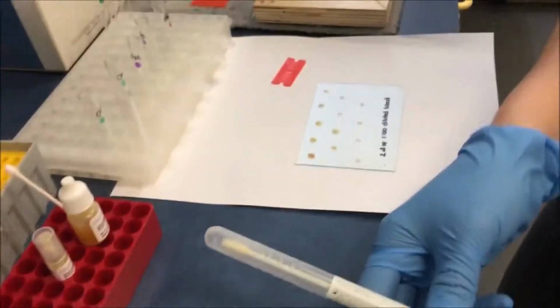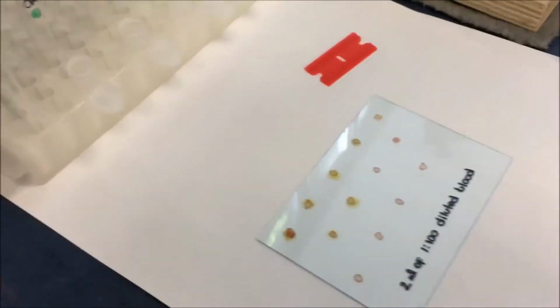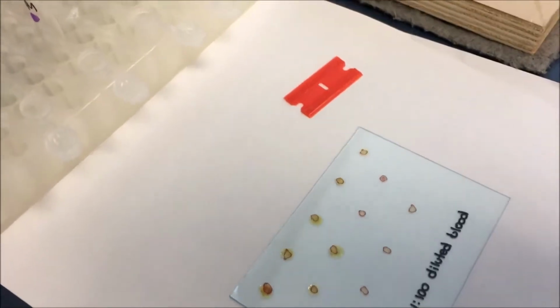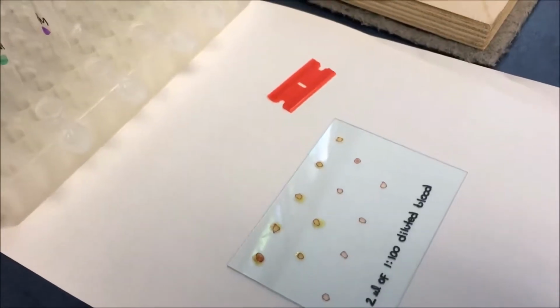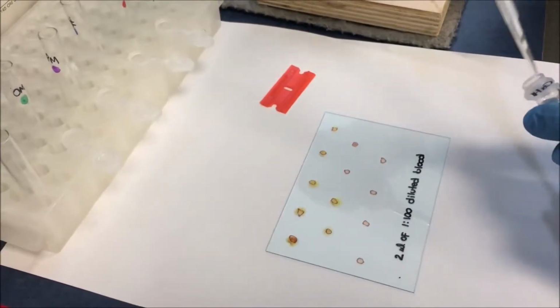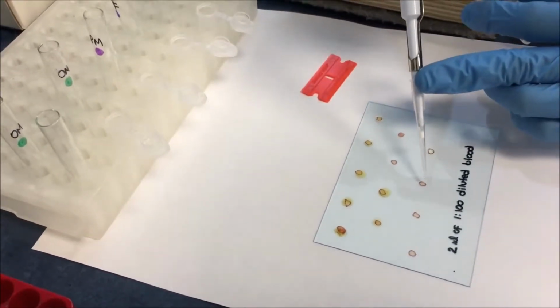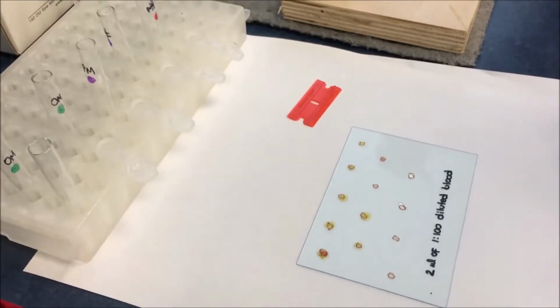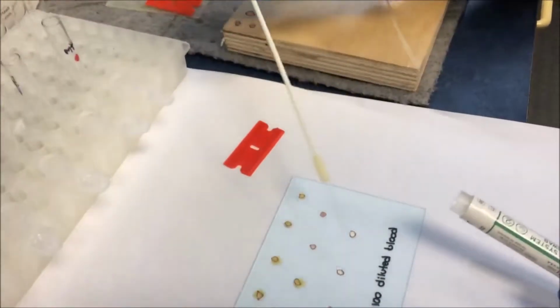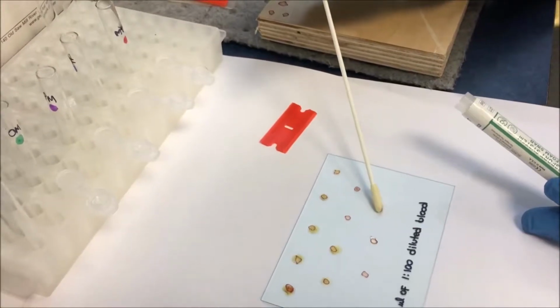The first thing with the swab is, and these are the different samples which have to be collected. This is on a plastic surface, where we already have the samples dried out. So the first thing in sample collection is to moisten the sample if it is dried out. In moistening the sample, usually it is just simple water or TE. So in this process we have moistened the samples, and then we're going to take out a classical swab and swab the surface.